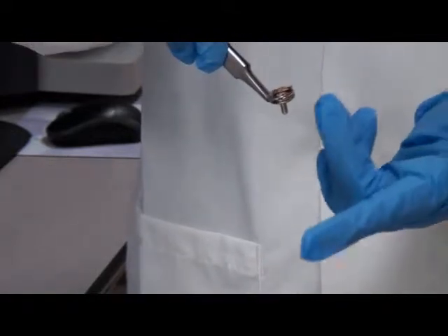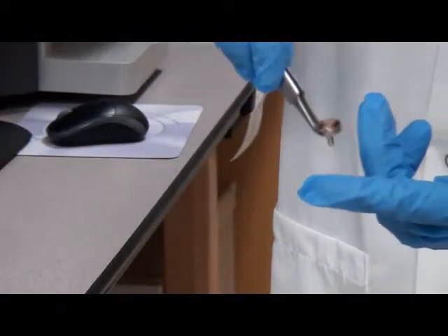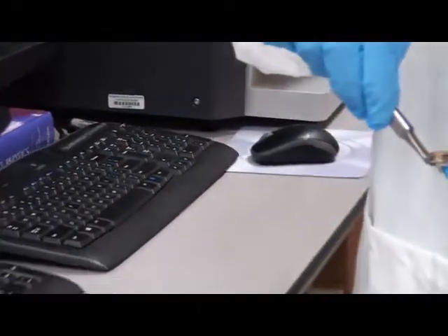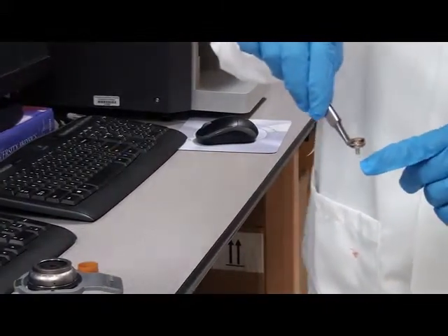Thanks to Nanoscience Instruments, from where we bought our SEM, they gave us this sample and it looks really beautiful. You are going to see this image under the electron microscope. This is a stub on which we mount our specimen, and it is gold sputtered or gold coated.